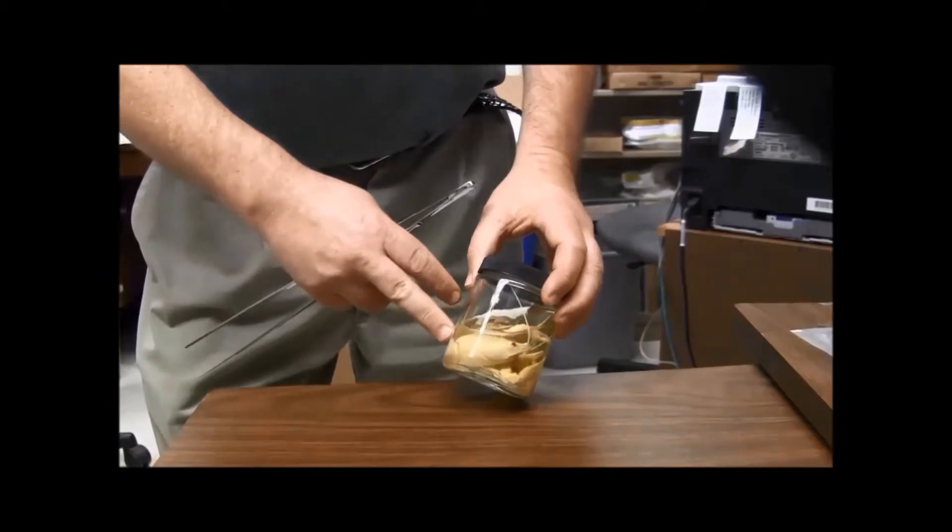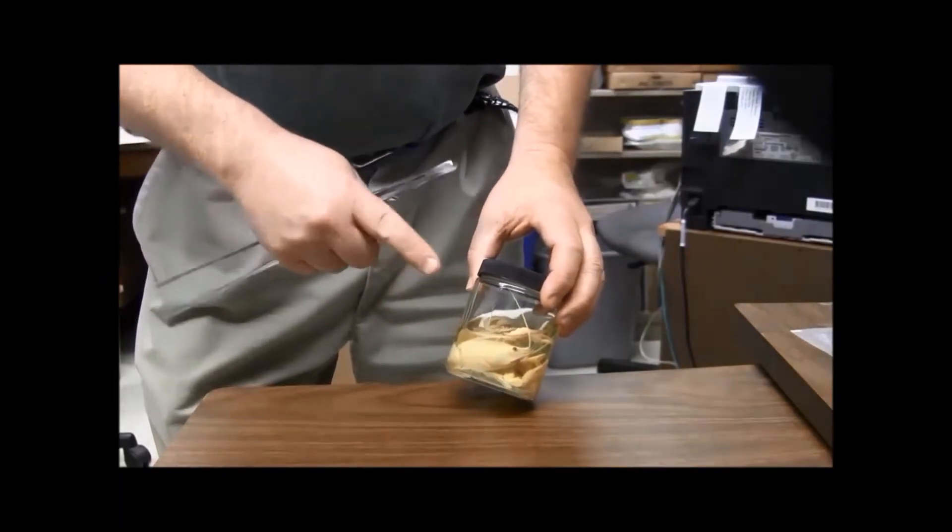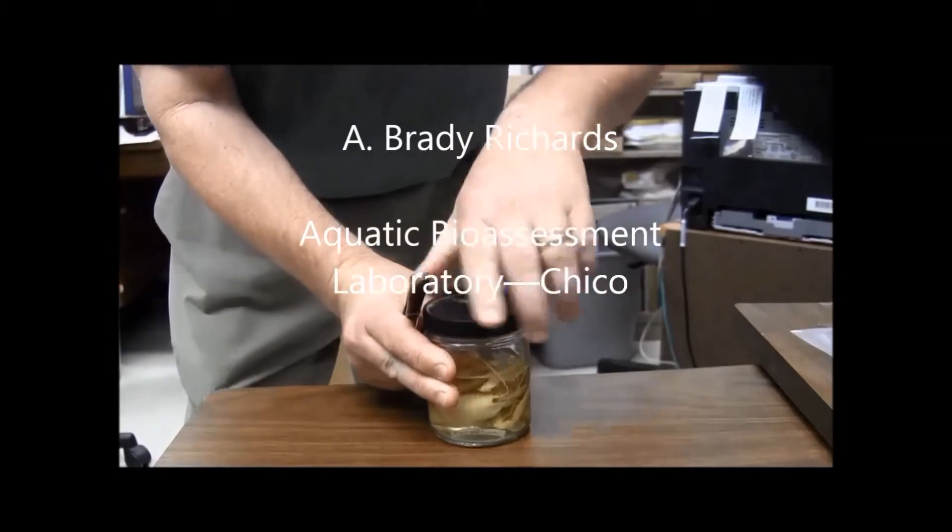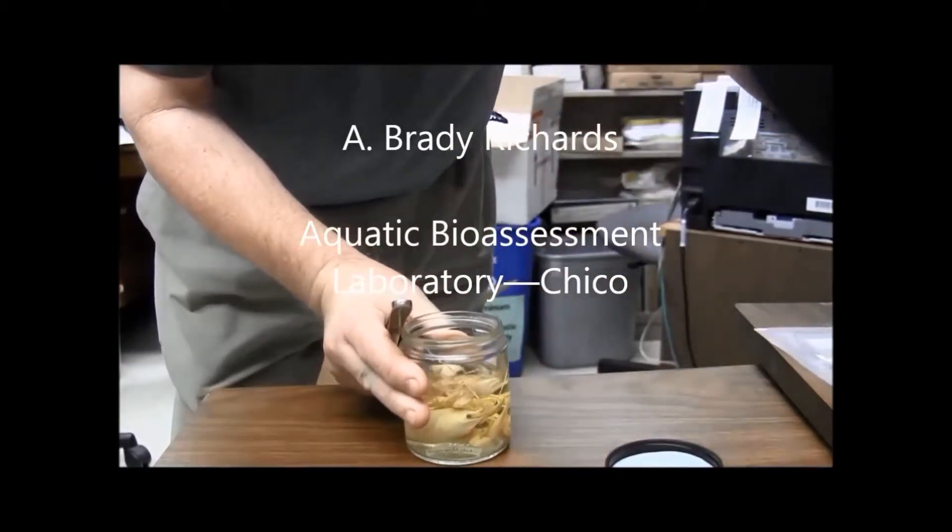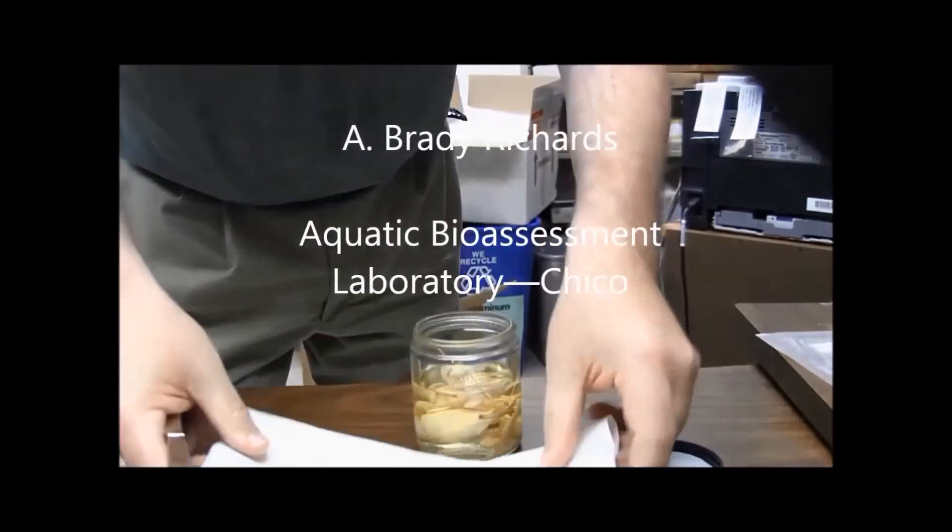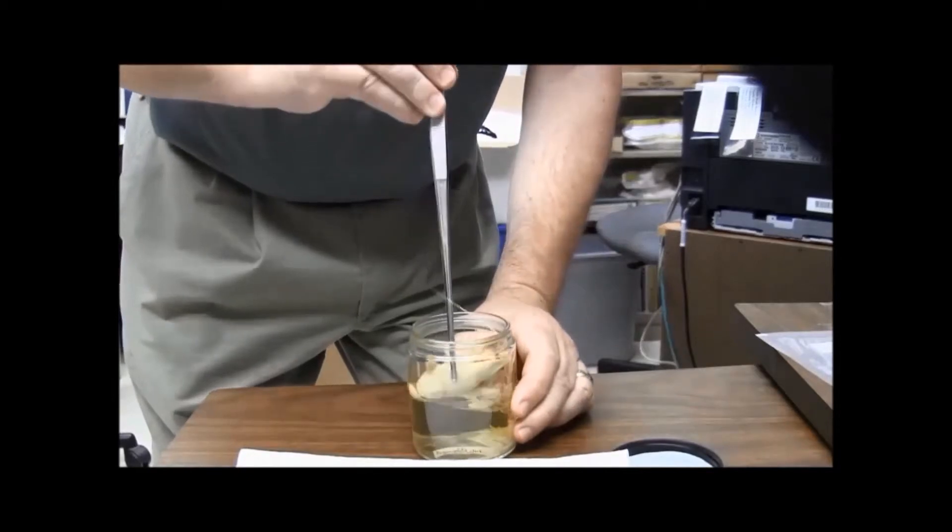So sometimes you have specimens that are large that you like to ship. So it's really simple. So you remove your specimens.